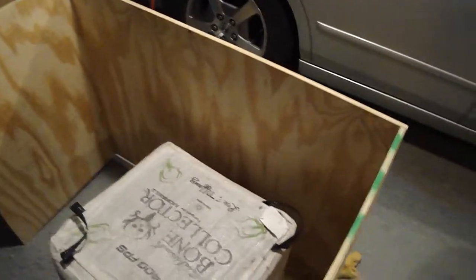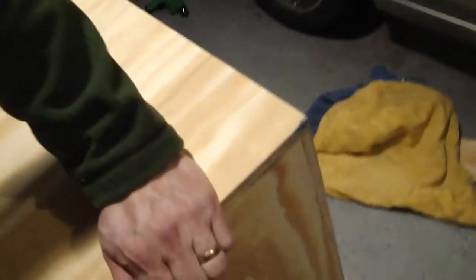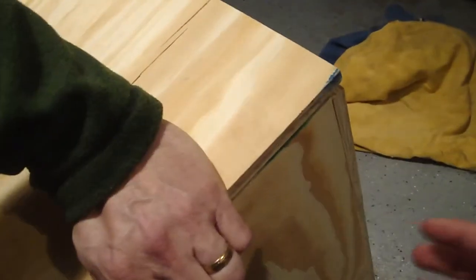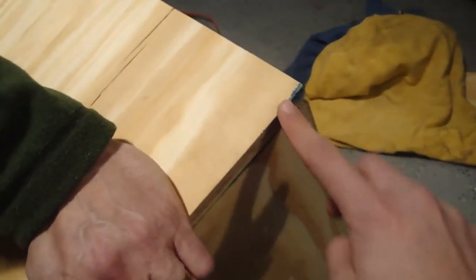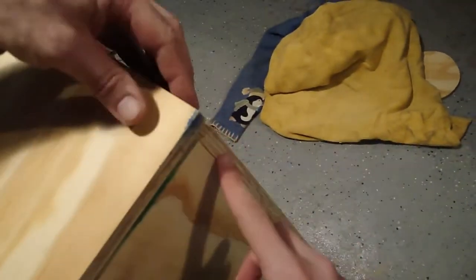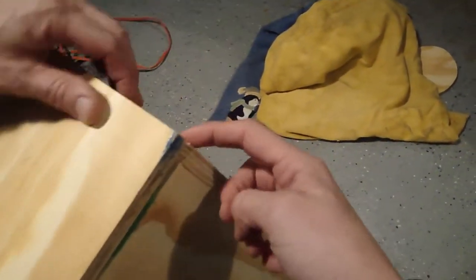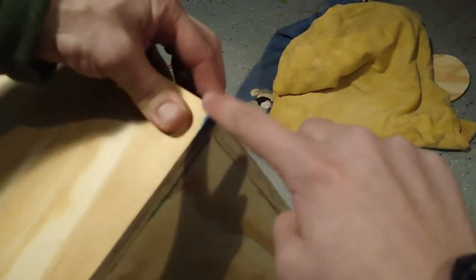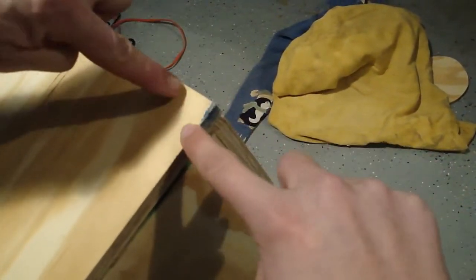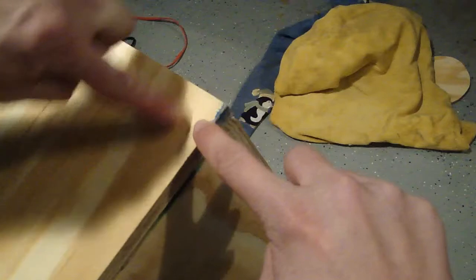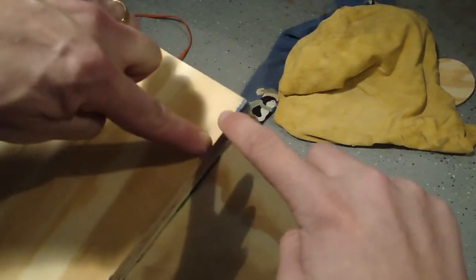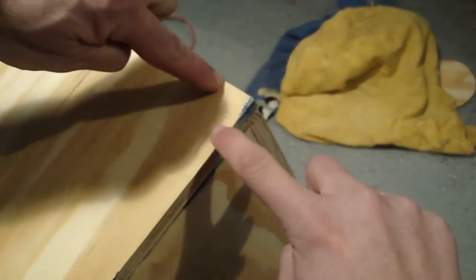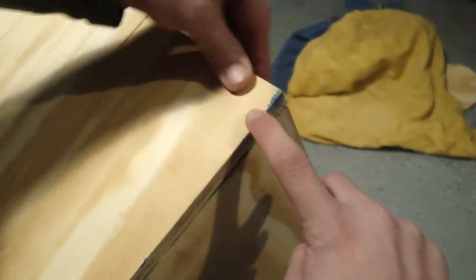We're going to have to make sure that we drill our hole and put our screw not right here because there's a screw going in here. So if we put a screw down this, it would collide with the other screw. So we have to make sure to drill about right here. Probably one here and probably one there.